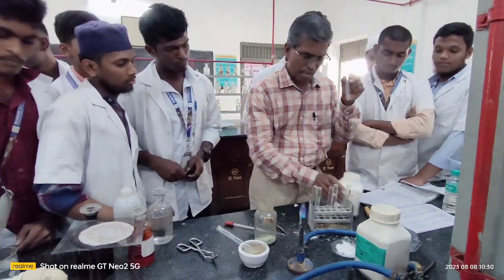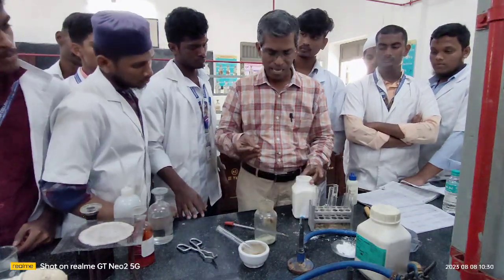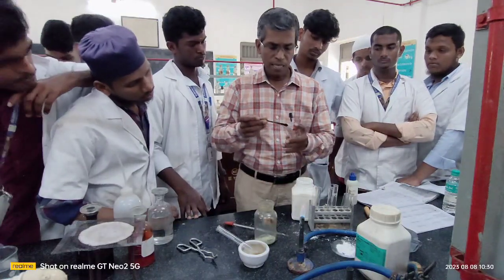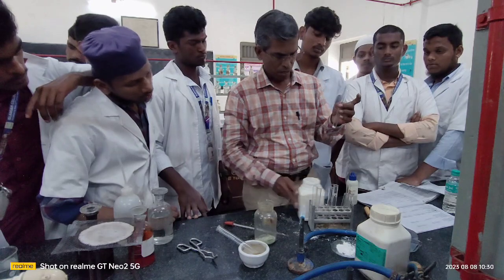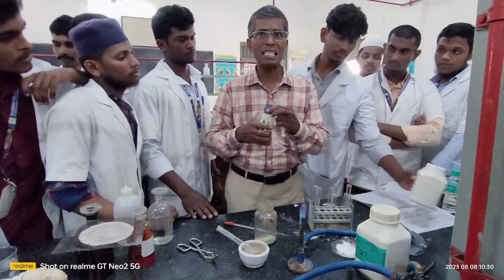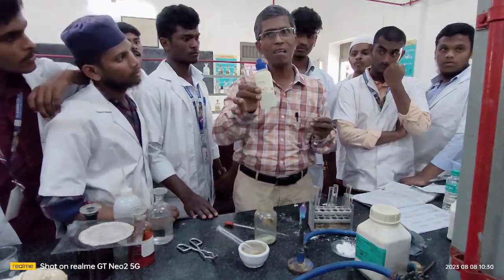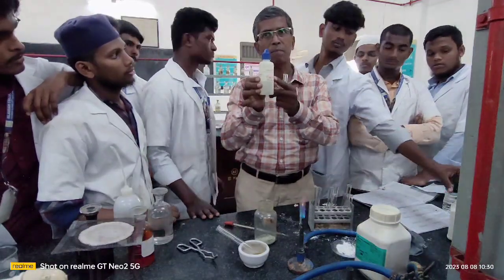For this, I am taking a little carbohydrate, that is the given organic compound. I have taken it in this. Now to this I am adding 2 or 3 ml of Tollens reagent. Remember, this is commercially available Tollens reagent.